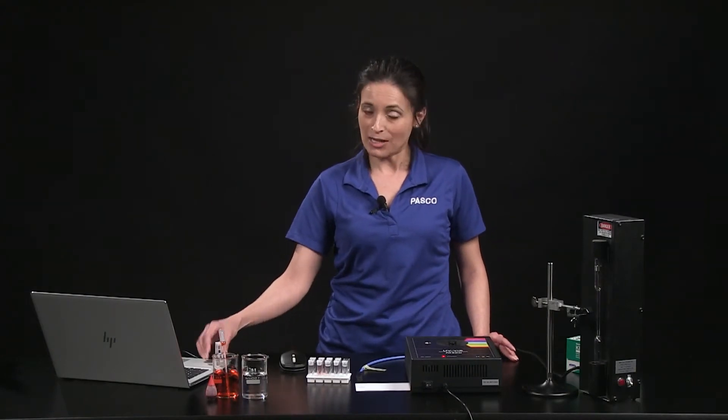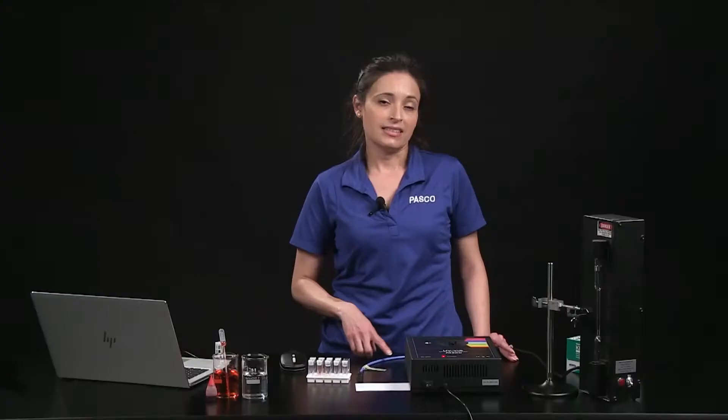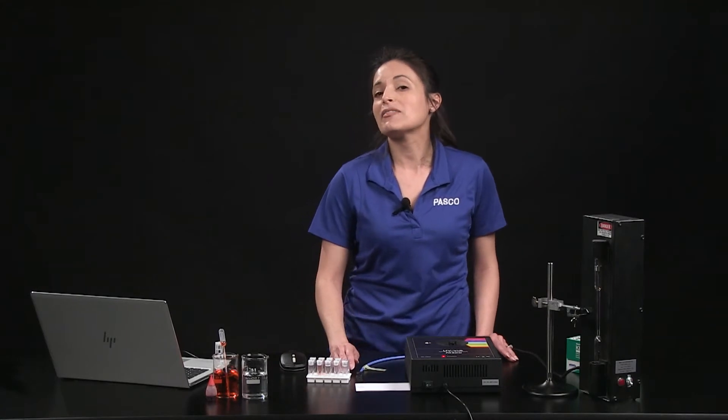Another optional accessory is the fiber optics cable, which you can use to investigate the wavelengths of light emitted from sources such as gas spectrum tubes.